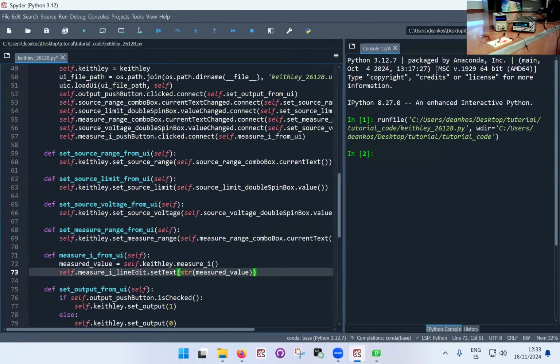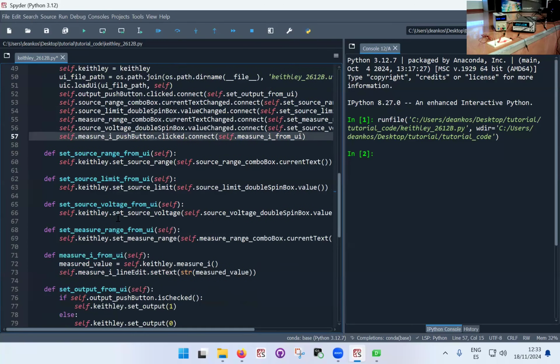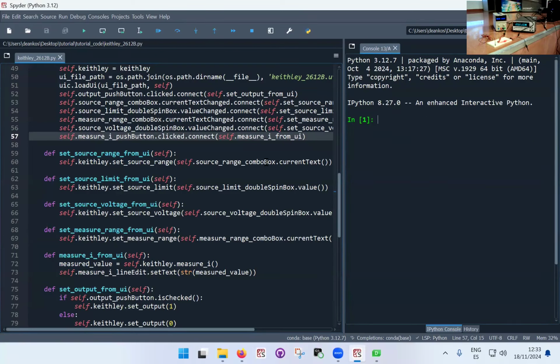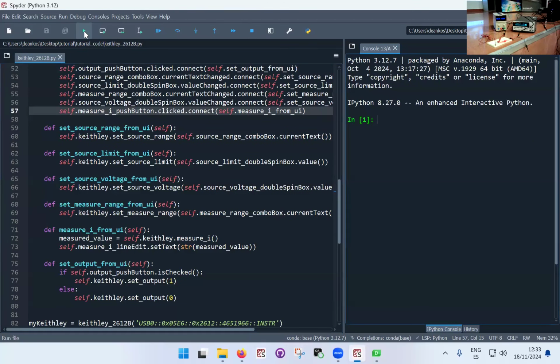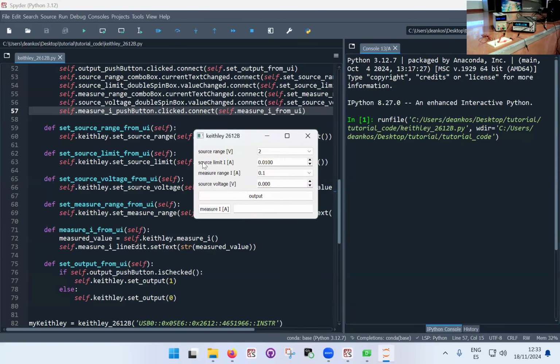Okay. And finally, this is actually already connected. We already connected the click button with the measured value from the interface. So I'm going to save that and make sure that this is saved as well. And now we're going to execute it and let's see if it all works or not. All right. So I'm going to keep an eye on the Keithley here. I'm not sure what you're going to be able to see. The source limit, I don't think we're going to be able to visually see anything in the instrument changing. But the measure range, in principle, should trigger some change.